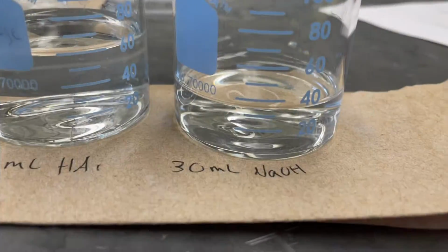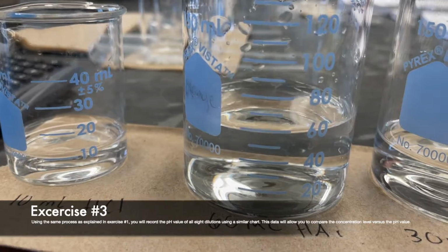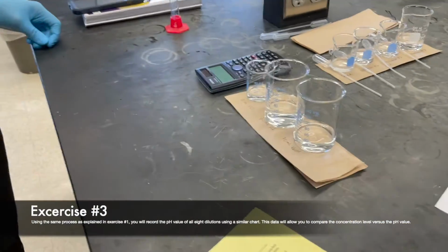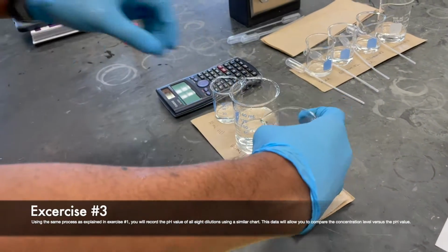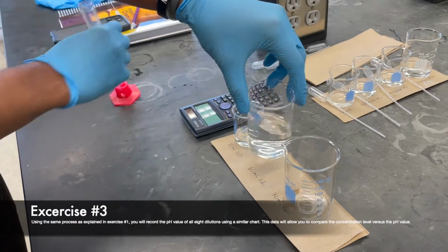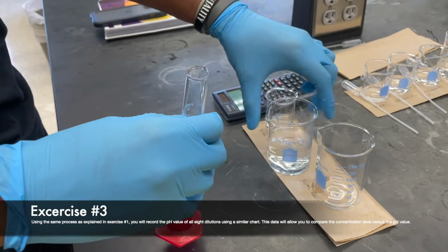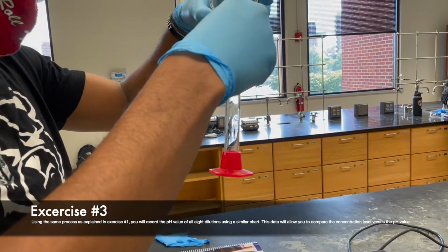In order to create the buffer that is needed for exercise number 3, you will need to mix 30 milliliters of a 0.02 molar solution of sodium hydroxide with 60 milliliters of a 0.02 molar solution of acetic acid. Also, create a separate beaker of 30 milliliters of water in order to compare the effectiveness of your created buffer.